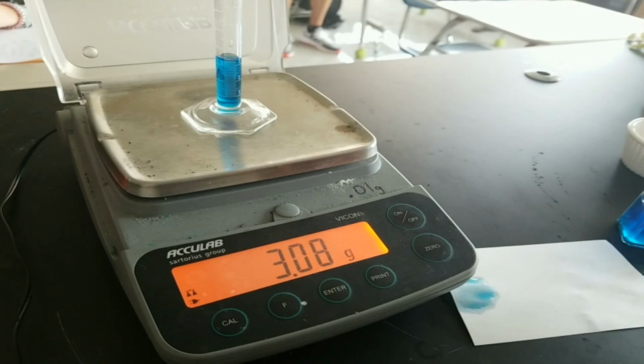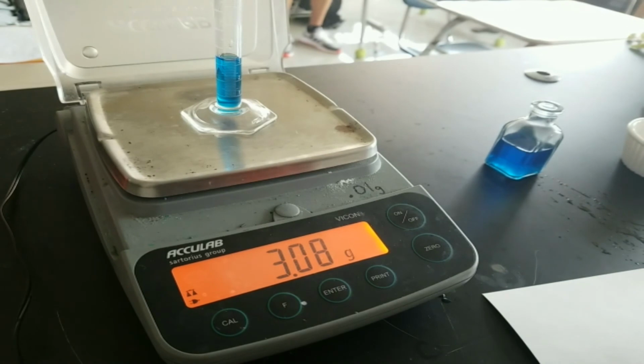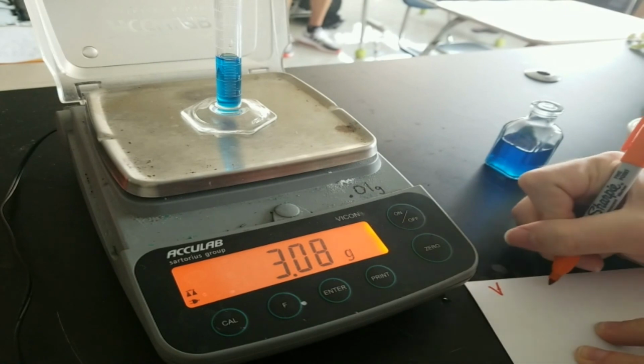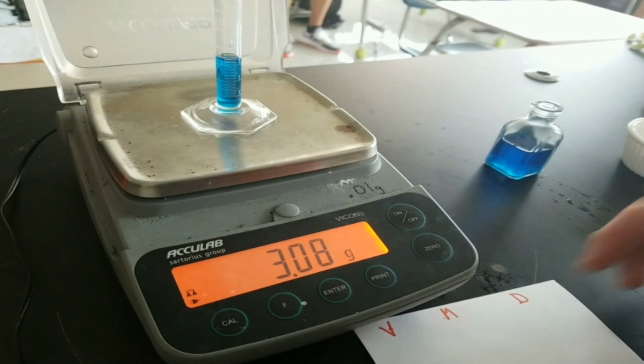Now I did spill a drop of the mystery chemical on what I was going to write on. We're just going to throw that out carefully. We're actually going to let the teacher know. The teacher says, which is me, says it's okay to throw it out, so I'm just going to throw it out. So my first measurement, I've got volume, I've got mass, and I've got density. The nice thing about doing the liquids is you're only going to have volume, mass, and density. You're not going to have that volume of water, volume of metal, and water.